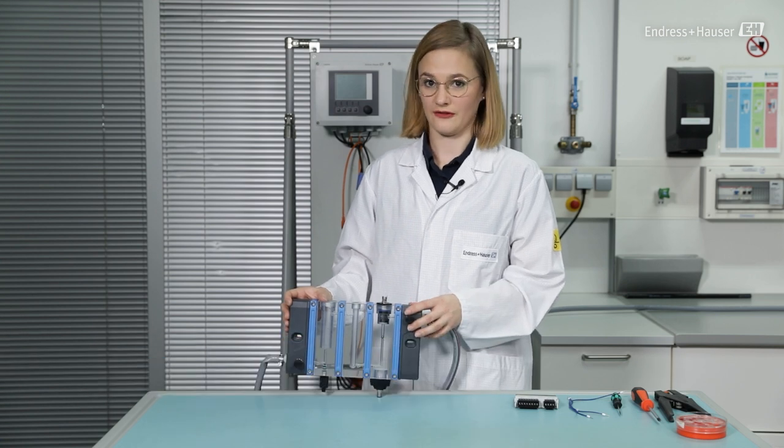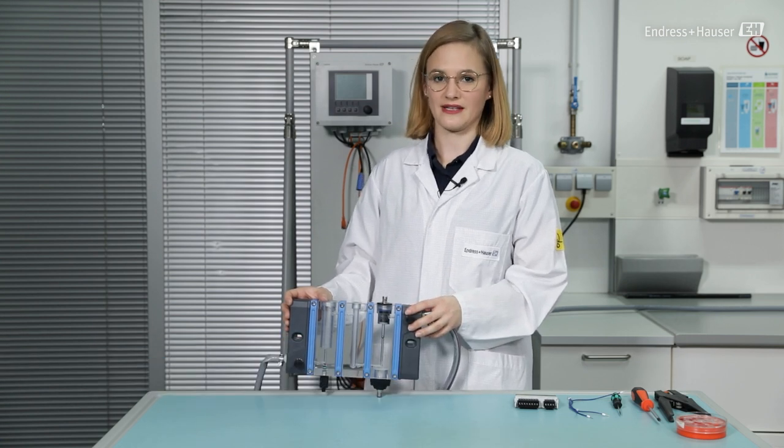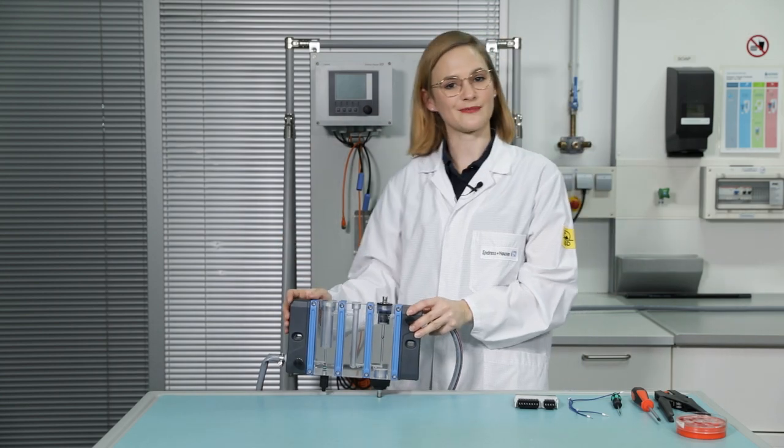Hey, I'm Teresa and in this video I will show you how to connect the status indication light and the flow switch of the Flowfit CYA27 assembly to Liquiline CM44 transmitter.